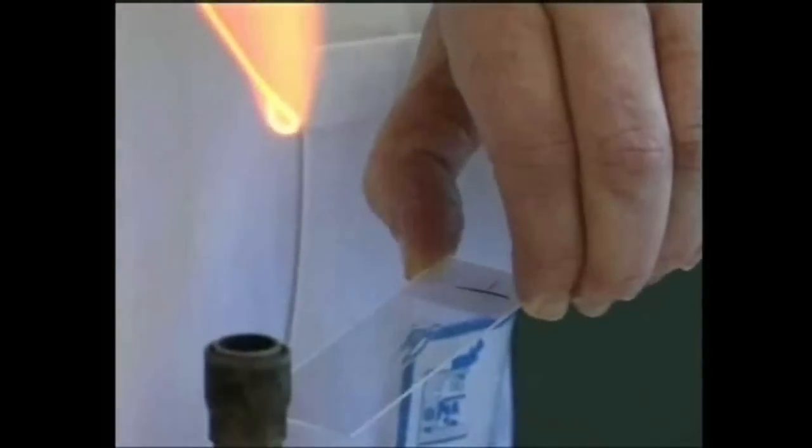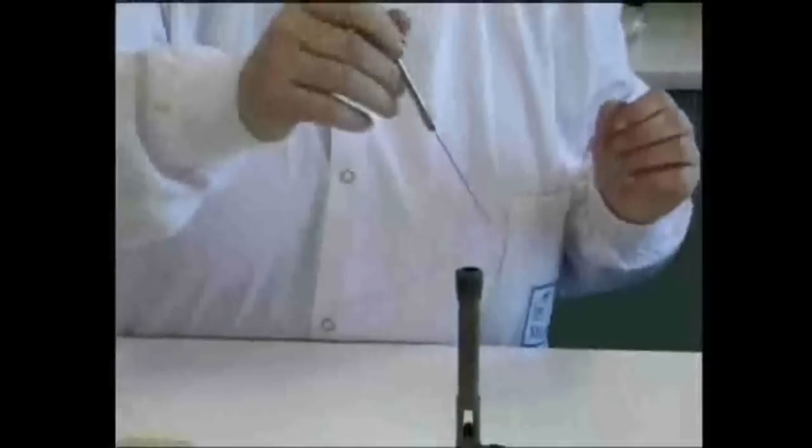Spread the smear across the slide. It's important that the smear isn't too thick, because you'll need to see individual cells under the microscope.